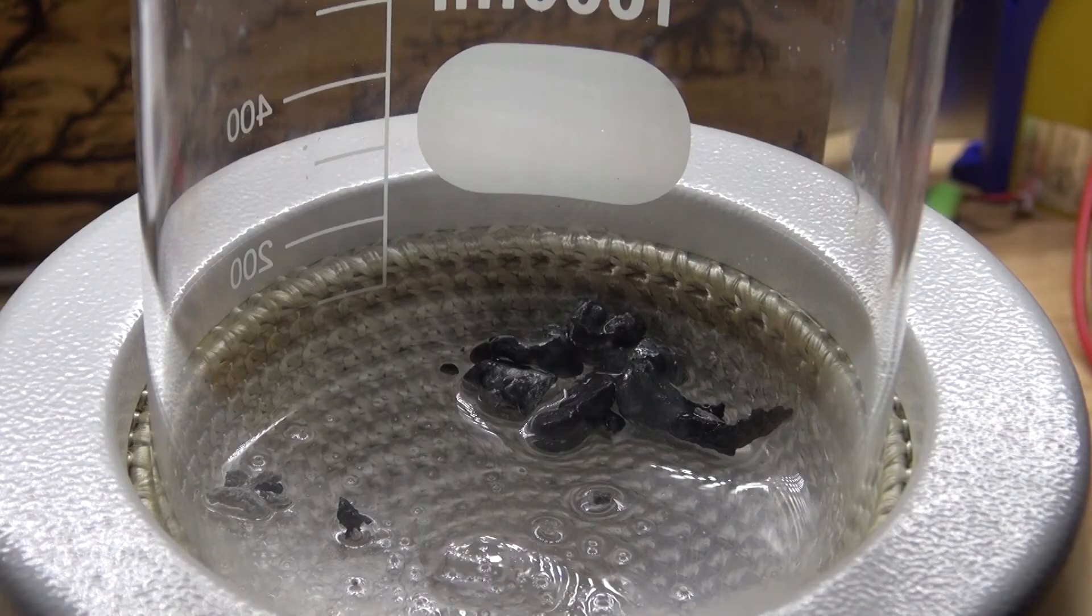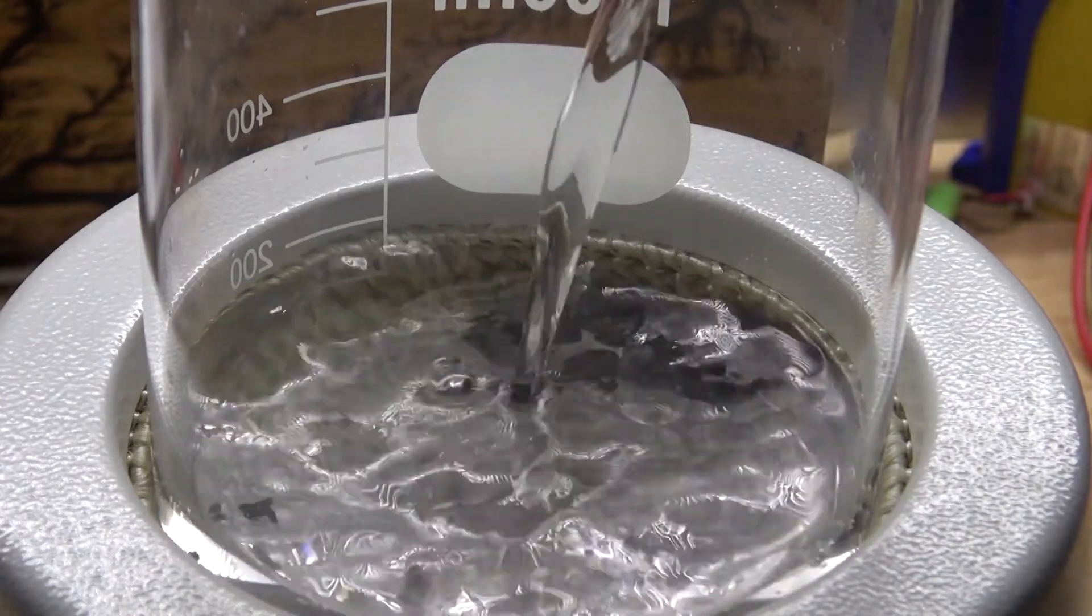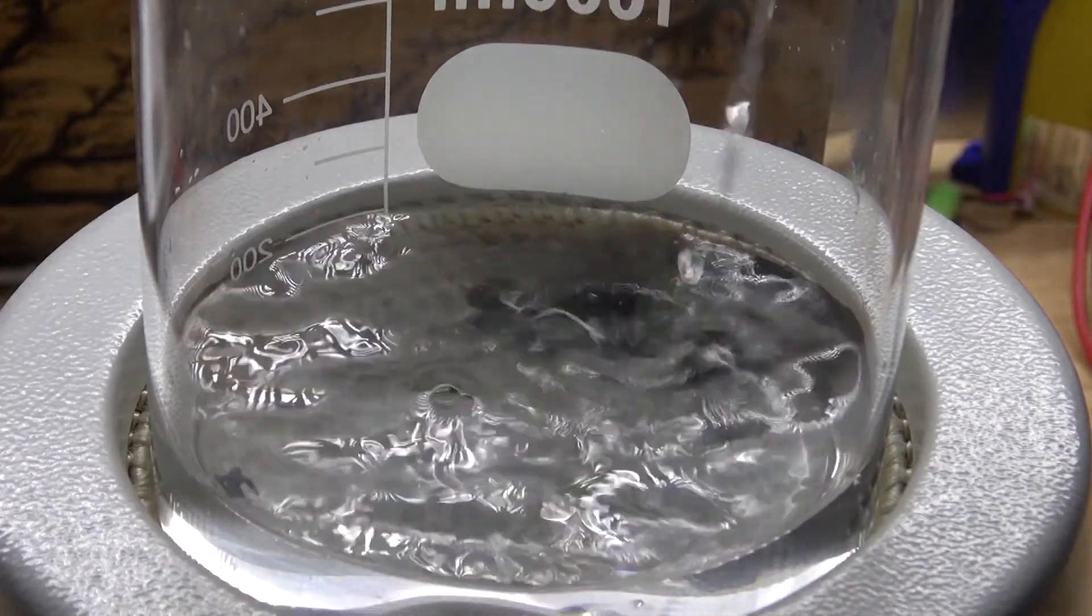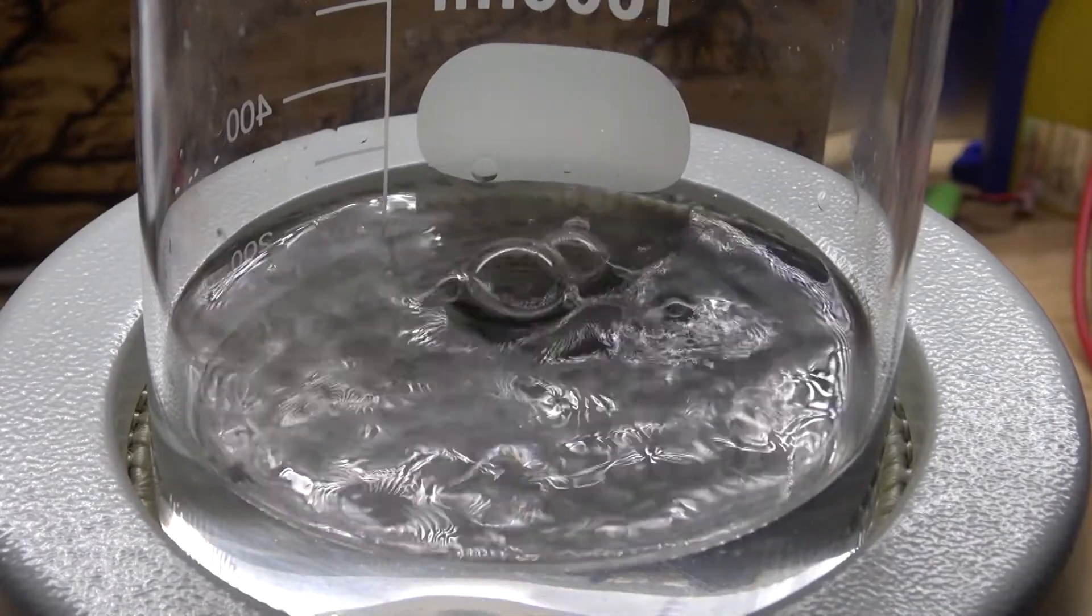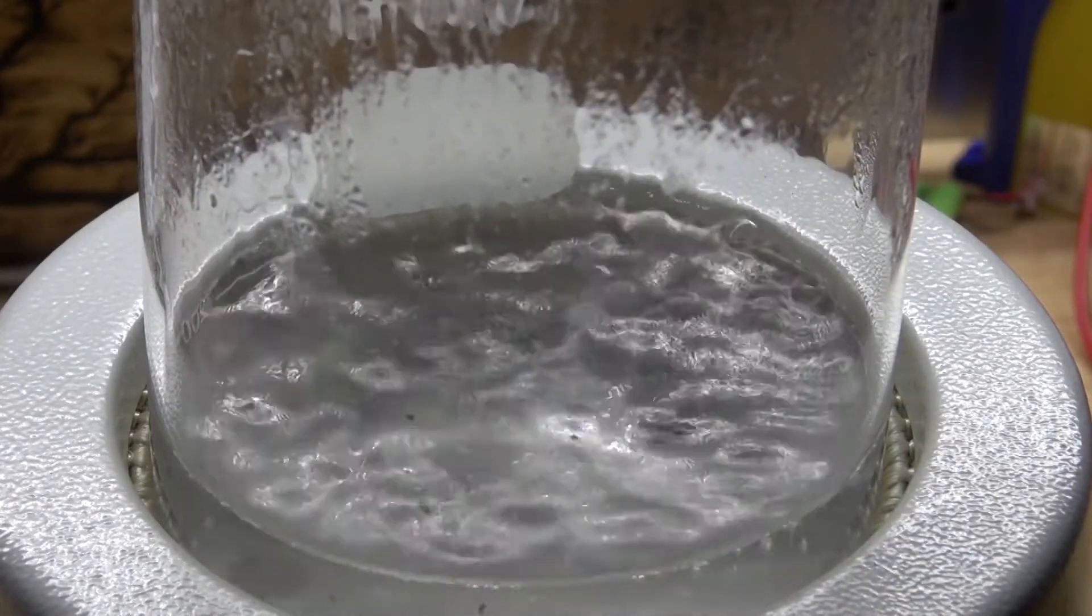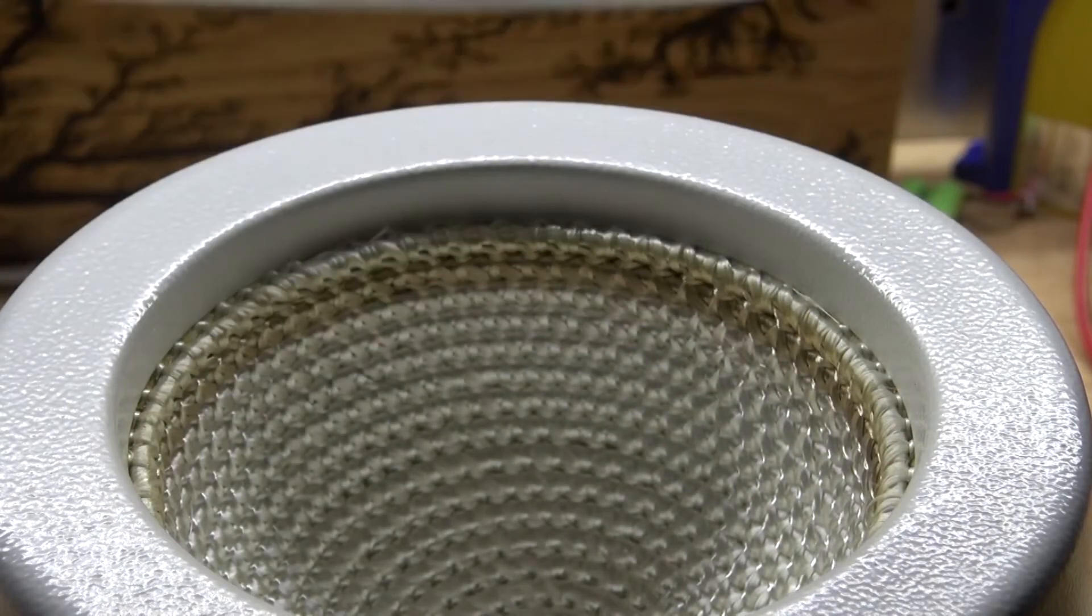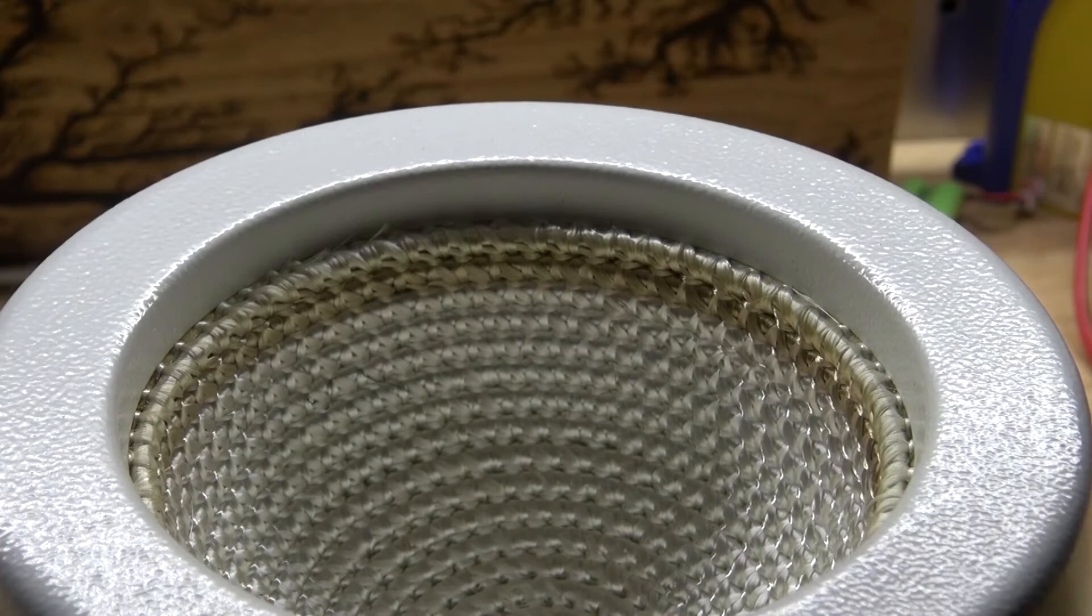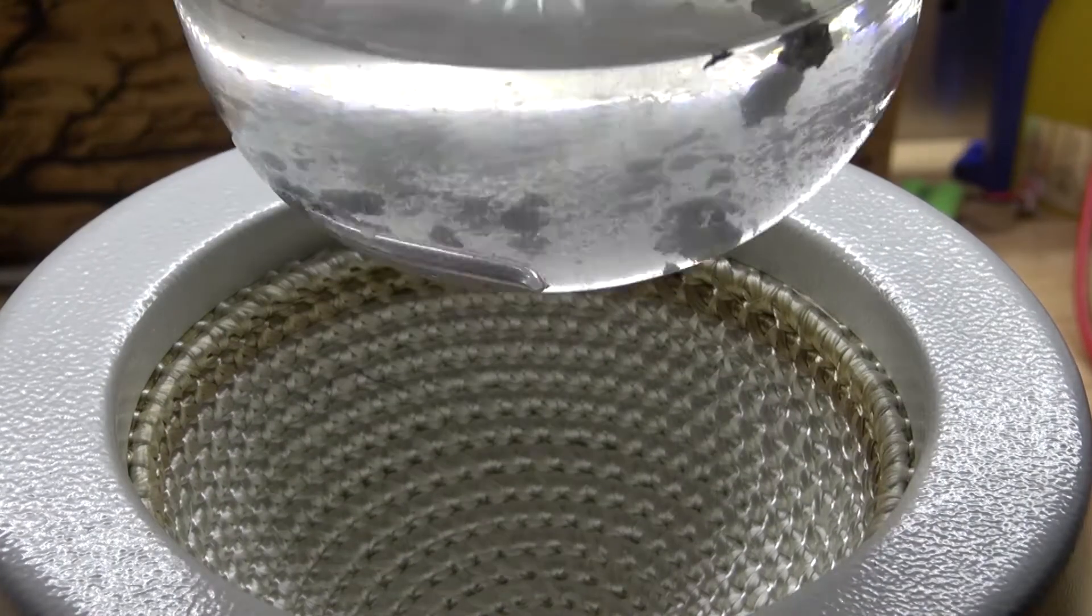What I'm going to do is take this aluminum and gallium alloy and place it back inside my beaker. Refill it up with more distilled water, just like this, and then bring it back to a boil so that way I can restart the chemical reaction. And there we have it. I brought it back to a boil, and it should look just like this. Shake it around. And as you can see, the gallium is now freed from the aluminum. And there we go. It should look just like this.